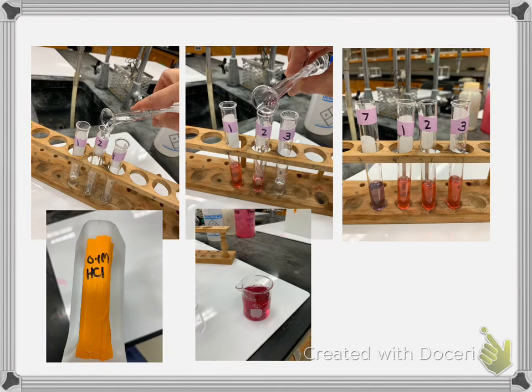And so then started the process. I did 3 samples, so we're only looking at sample 1, but I was doing 3 samples to make sure it was all working out okay.